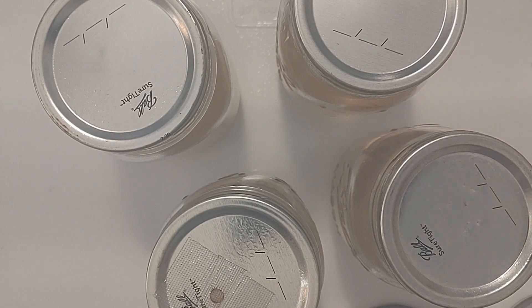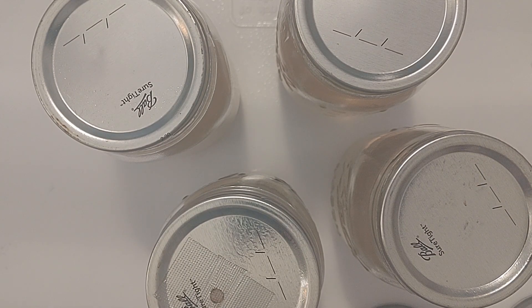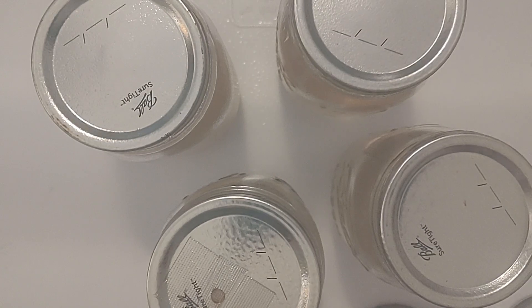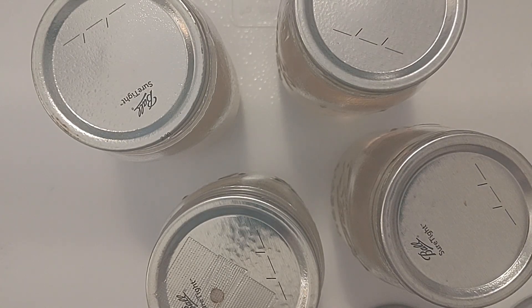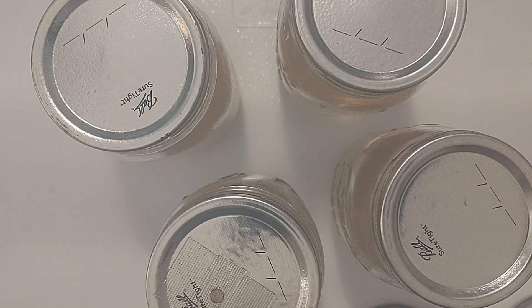Hello friends! Welcome back to Mycology Exploration. We are in the still airbox and I just sprayed everything with alcohol.